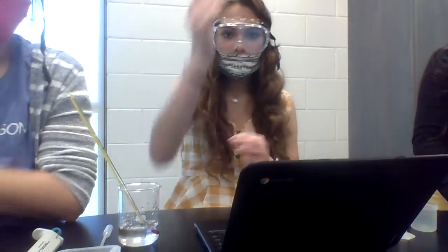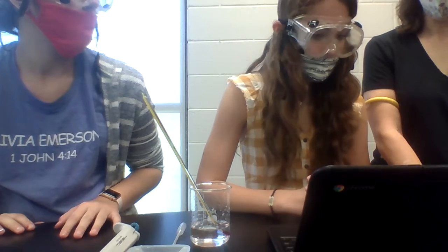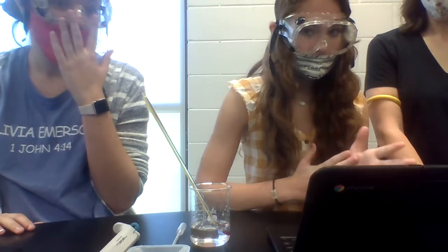Have you gotten all your data? Yes, we're just taking the temperature of our water. All right, why don't you just kind of wrap it up, tell them the last few things you're doing, and then you can stop it.